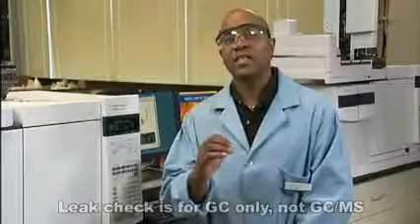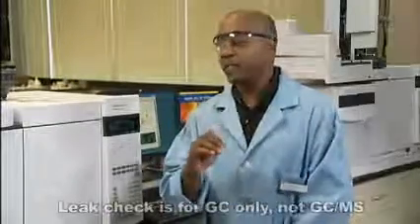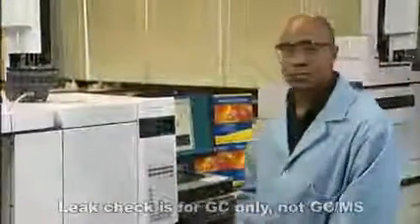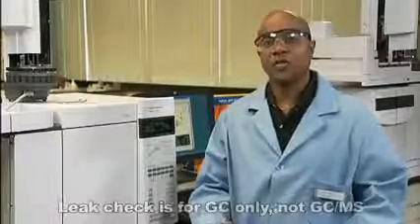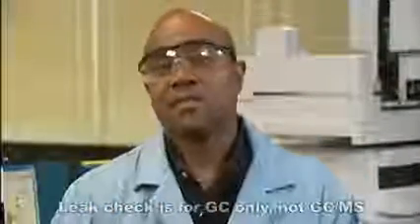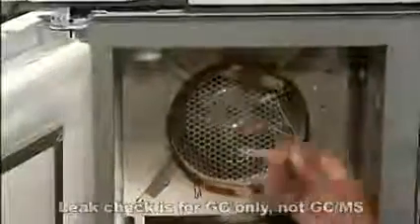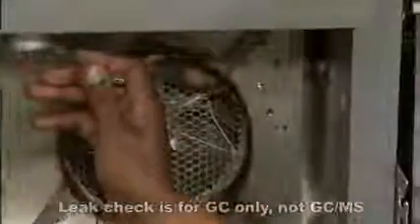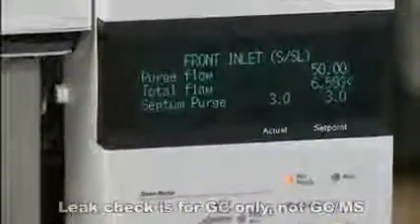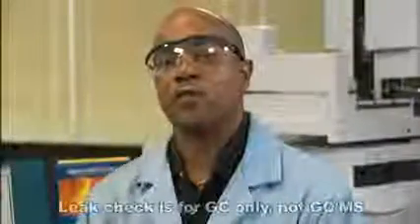I'm going to start from the top of the inlet and work down. First, the septum nut. Next, the closure to the liner, that yellow little lever that we did. That's not it. Now I'll try the column nut. Okay, there we are. You see how the total flow has dropped to less than 10 mils a minute? This is probably good enough for our example.